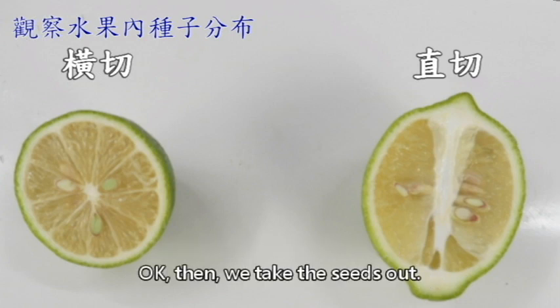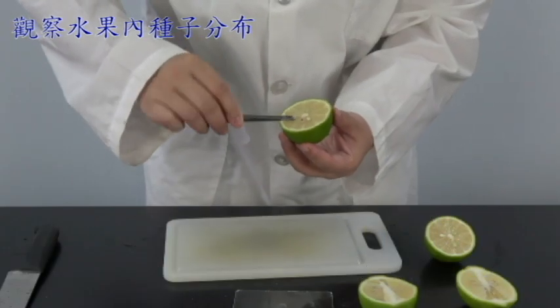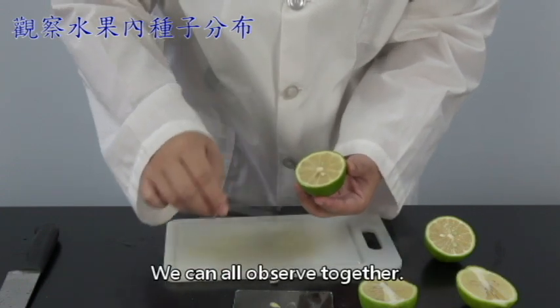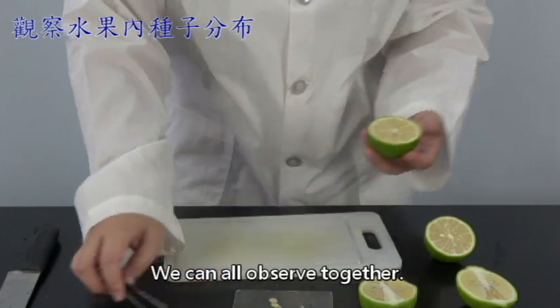Okay, then we take the seeds out. Some have been cut open, some have not been cut open. We can observe them all together.